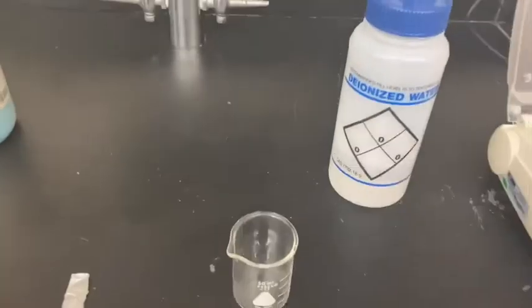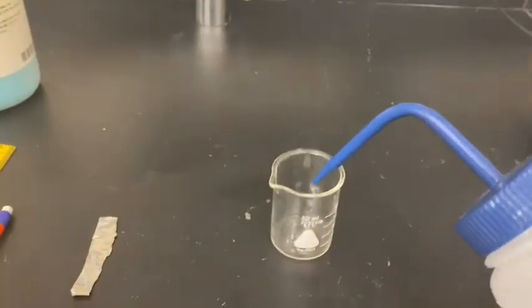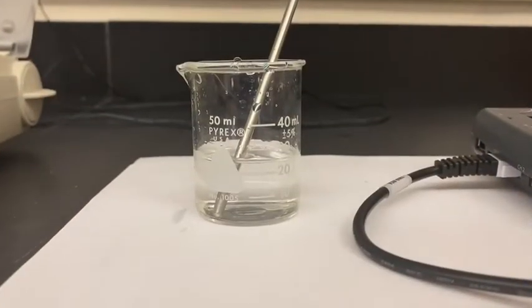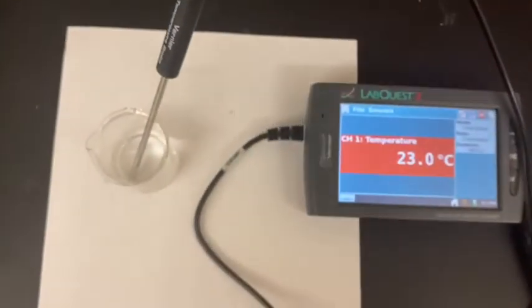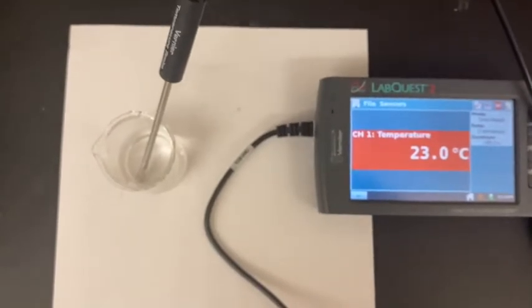I know this says deionized water on the container, but it is actually distilled water. I am going to fill my beaker up about halfway. You can see it is clear, colorless, and 23 degrees Celsius.